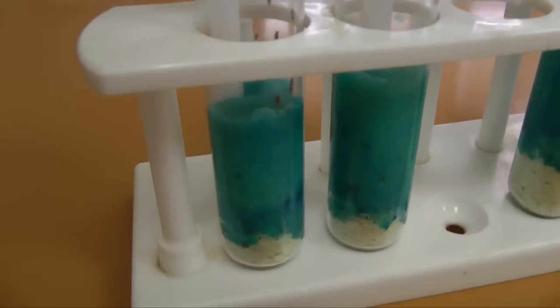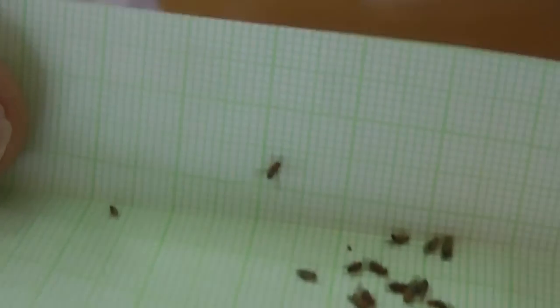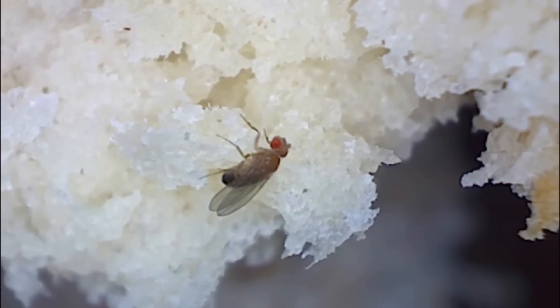It is a good idea to use different rooms to perform this transfer. Flies can escape during this transfer and the experiment would be ruined if a red-eyed fly, unnoticed, entered a white-eyed culture.